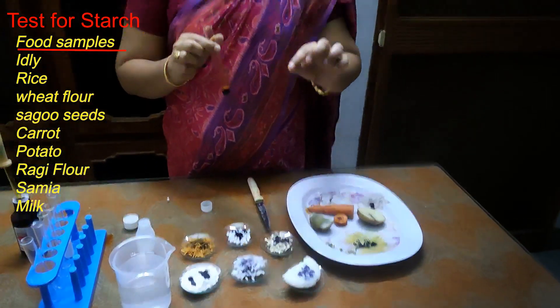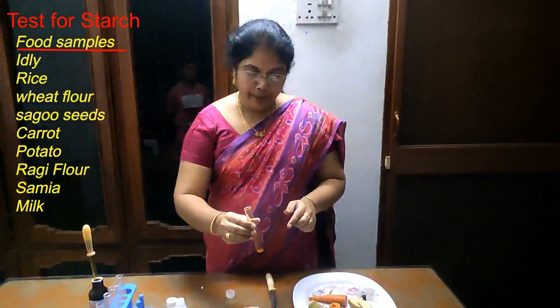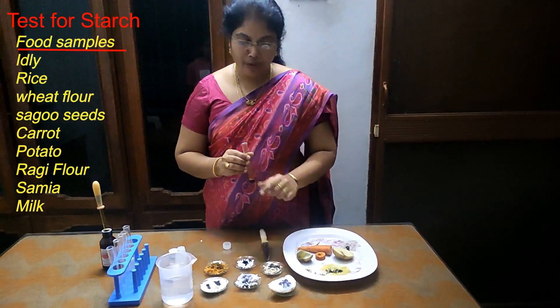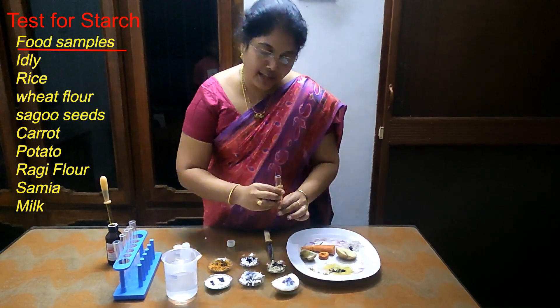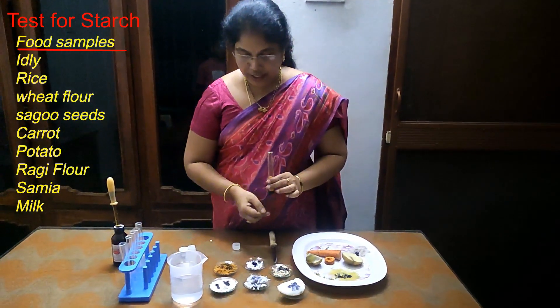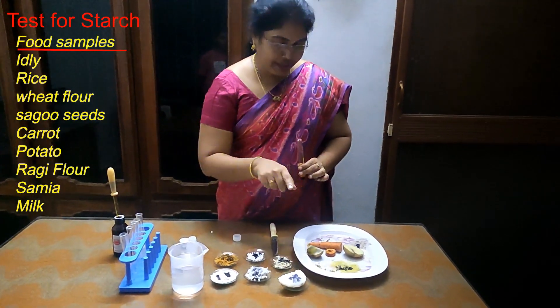We will add dilute iodine to various food samples. Food samples that contain starch will turn black in color.